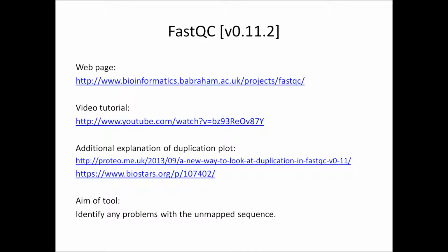Before I carry on, here are some quick notes about fastQC. The version I'm using on our Galaxy instance is 0.11.2, and I recommend using any of the 0.11 versions as there were some significant improvements over the previous versions. The author's main webpage at the Babraham Institute is here. That's well worth looking at because there are links to their web manual, which has a lot of useful information.